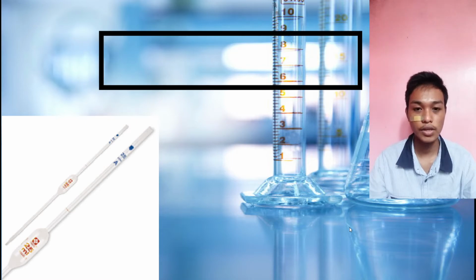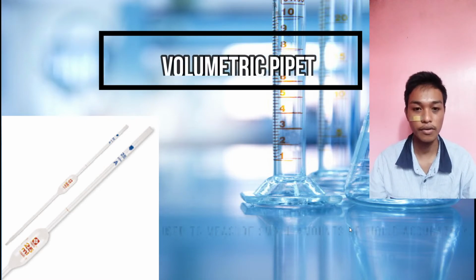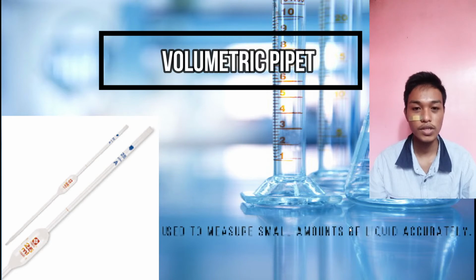Next is the volumetric pipette. It is used to measure small amounts of liquid more accurately. Never use a pipette by mouth. Use pipetting aids. They are suction devices that can either suck liquid into or expel liquid out of pipettes.